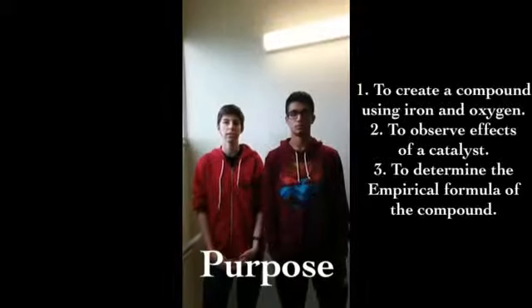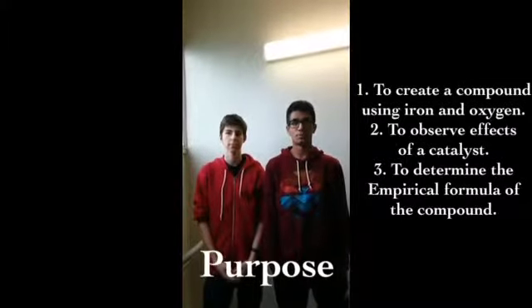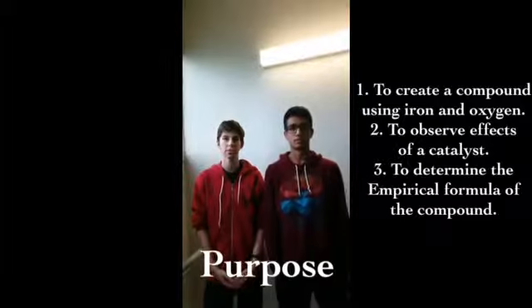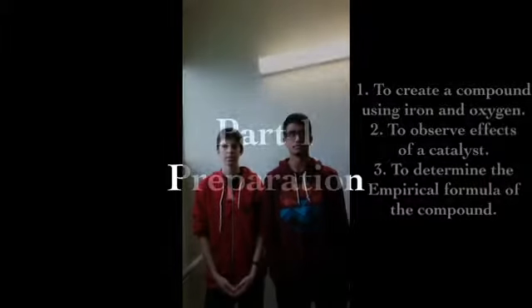To Lab 4C, determining the empirical formula of a compound. The purpose of this lab is to form the compound from the elements iron and oxygen, to observe the effect of a catalyst on a chemical reaction, and to determine the empirical formula of the compound produced in the chemical reaction.